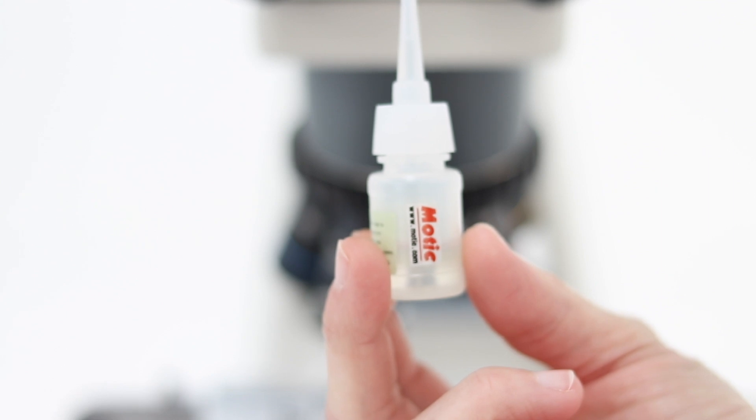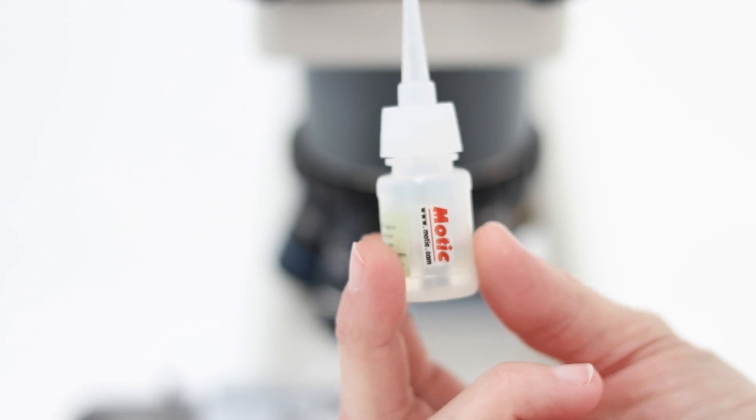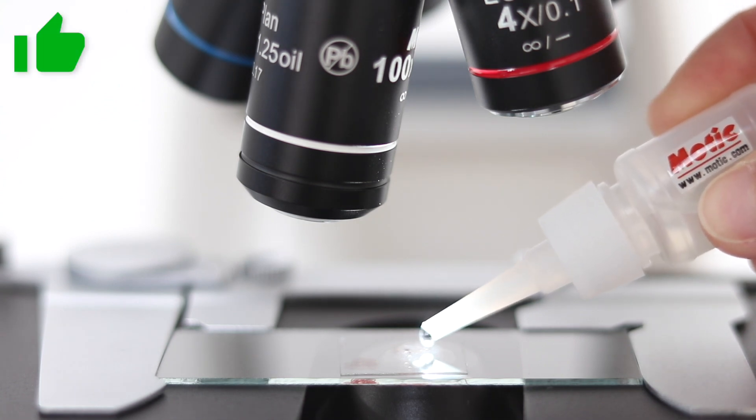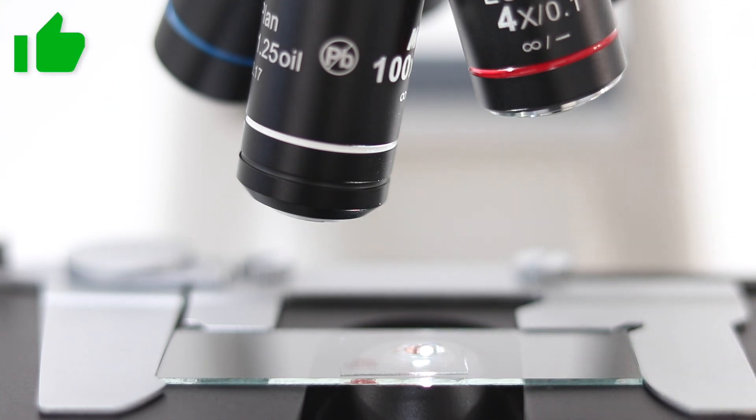When using the immersion oil, remember that less is more. This must be used sparingly. A single drop is just enough. Correct use will avoid getting other components of the instrument dirty.